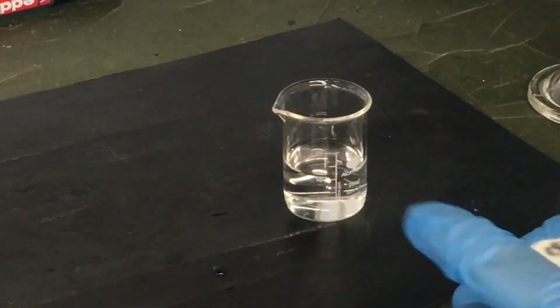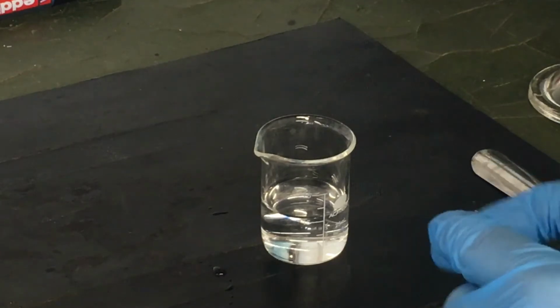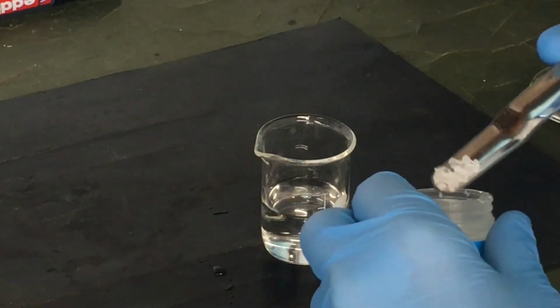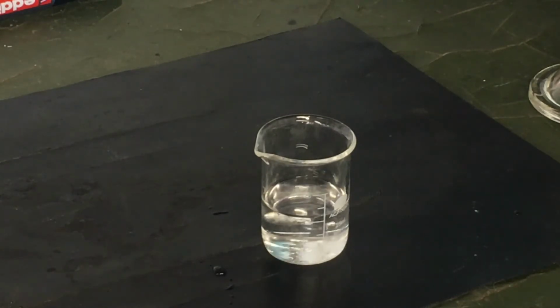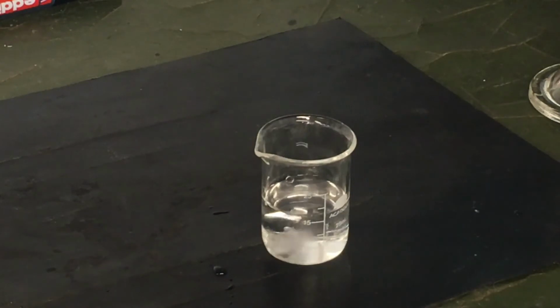For this experiment, the hydrogen peroxide is already in the beaker, and I will be adding small amounts of sodium thiosulfate. This is highly crystalline and pure, and you should notice something very interesting. I'll do that one more time with a much larger piece, and finally one more time.